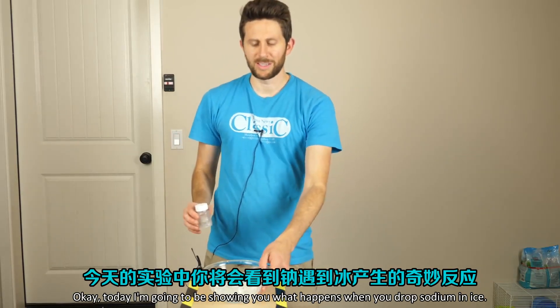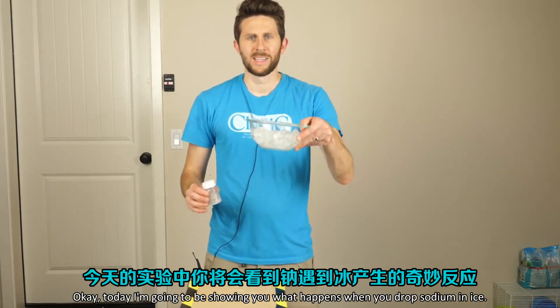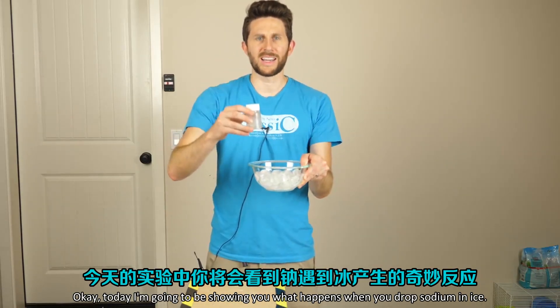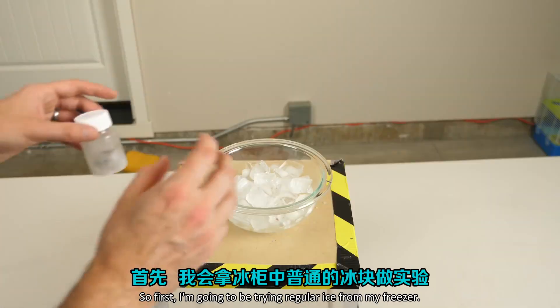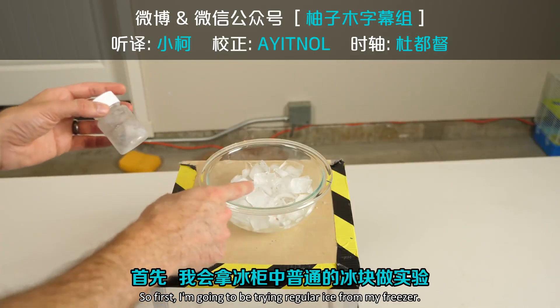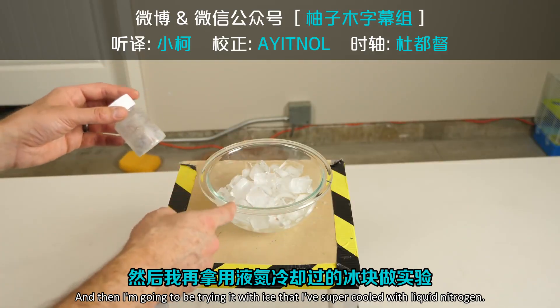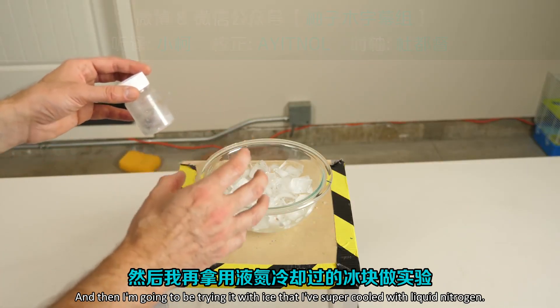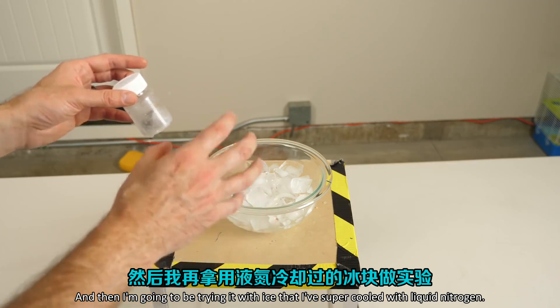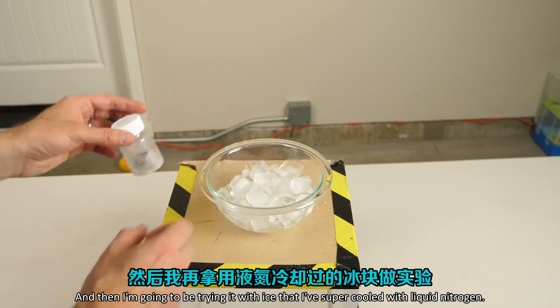Today I'm going to be showing you what happens when you drop sodium in ice. First I'm going to be trying regular ice from my freezer, and then I'm going to be trying it with ice that I've super cooled with liquid nitrogen.